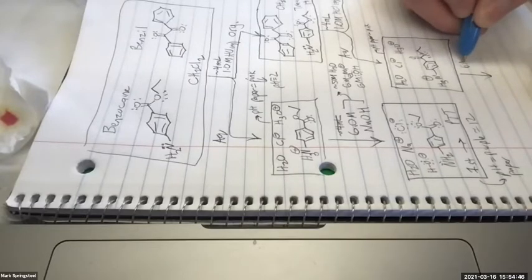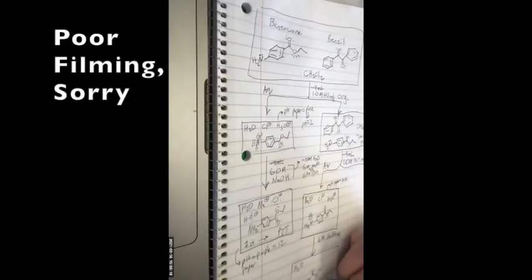So at this point, this was our colorless clear solution that then I added 6 molar NaOH to. And when I add that, it's mostly what? Water. Water. And does this react with the ammonium? Yes. And that's our precipitate. This is our second precipitate.